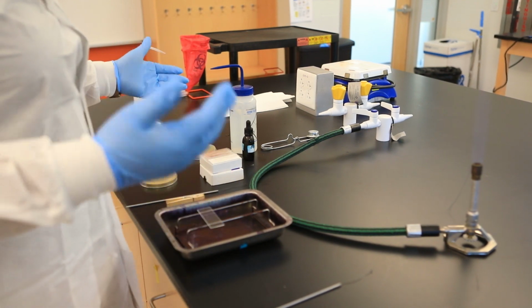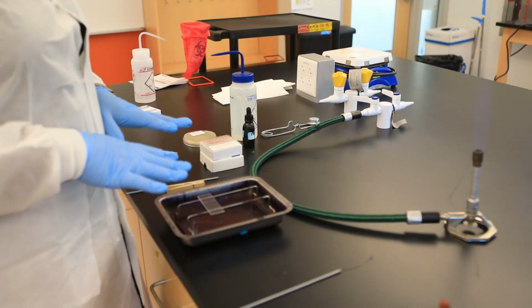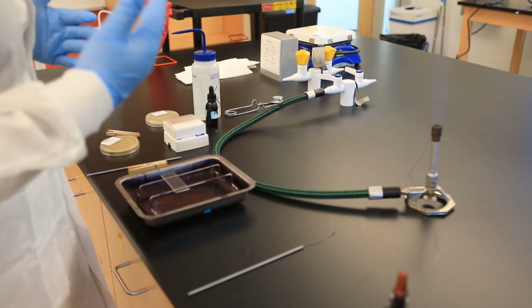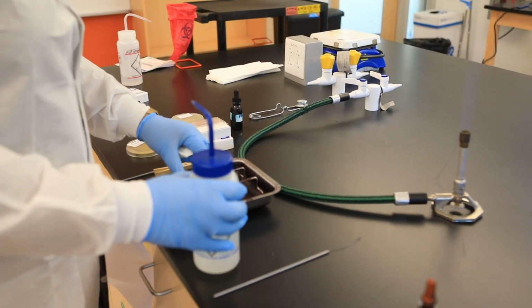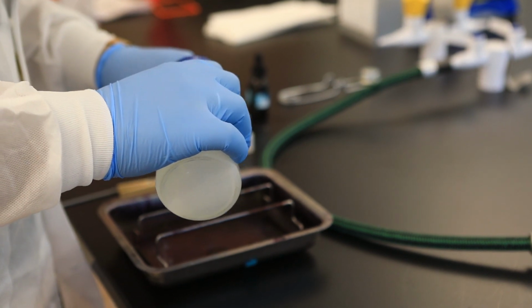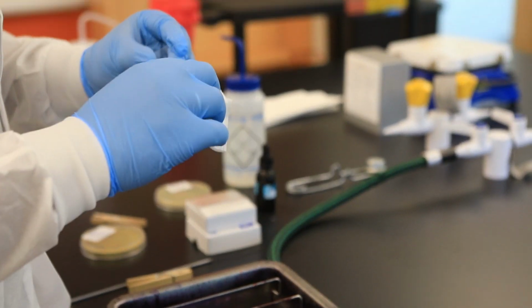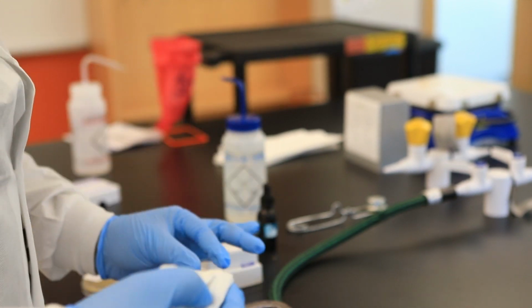So let's get started. The first thing you would do is wash or rinse the slide. Even if you take the slide from a nice fresh package, you always want to make sure you wash the slide to remove any type of debris or fingerprints and things of that sort. So I'm going to take this. I don't like to wash with tap water. Some do. I just like to wash with distilled water. And I went over in the video why it's called distilled and what makes it different compared to tap water.